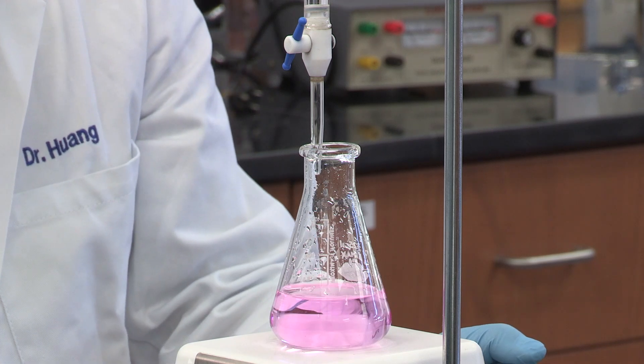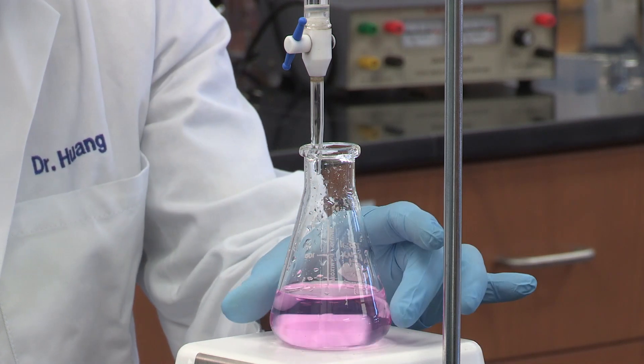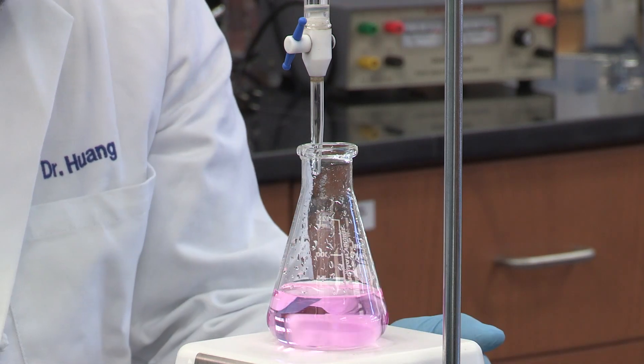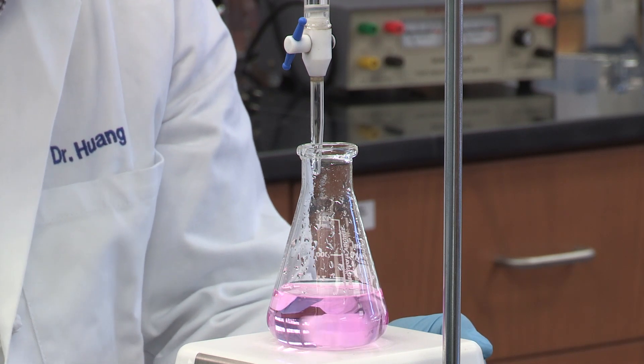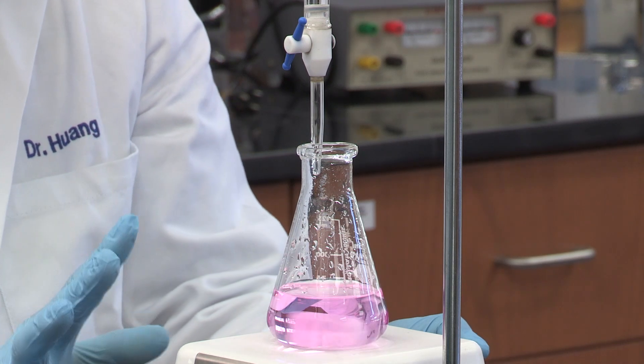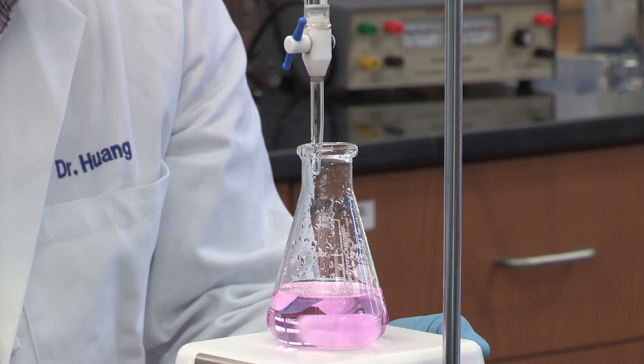Now you can see the color is light pink. So at this moment, if you're not sure if this is the end point, you have one solution to do this. Instead of to consider this is the end, you take the reading right now.